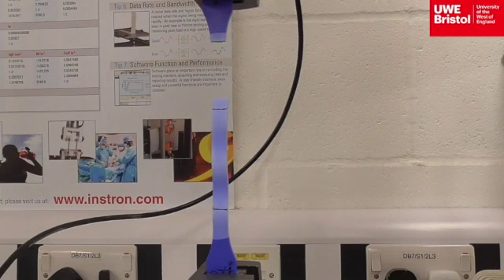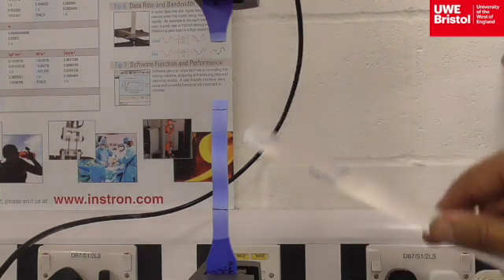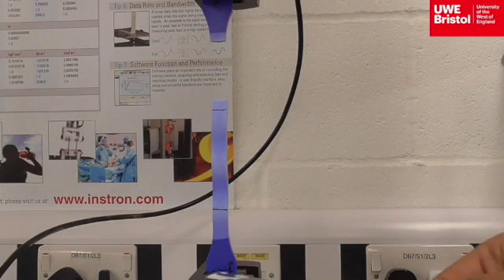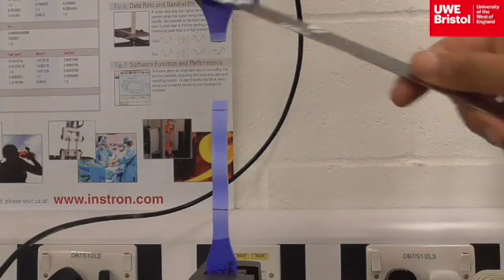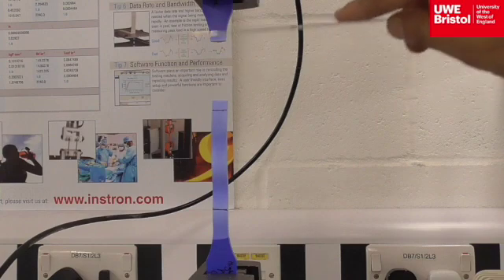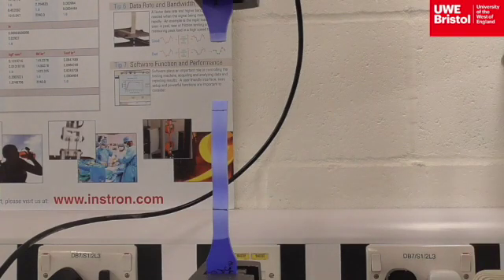Now there's a fracture. Also note the colour change, or the stresses remained only in the gauge length area. They didn't pass into the shoulders or enter the grip area, which means it was properly gripped into position. There is a large gap between the two halves. At point of fracture, the grips do not move, and the gap represents the elasticity in the polymer.